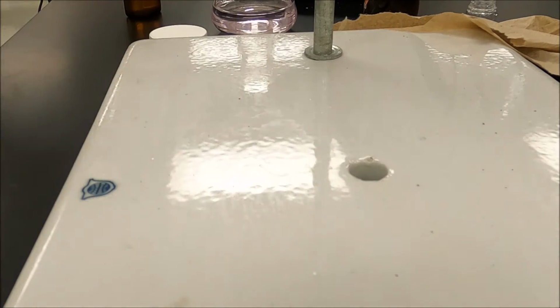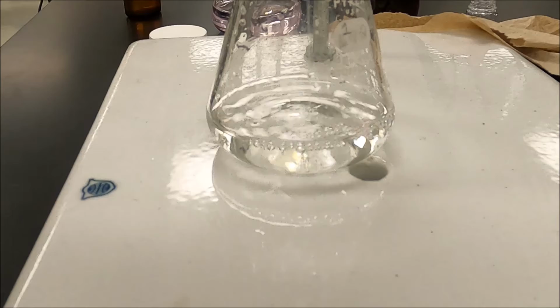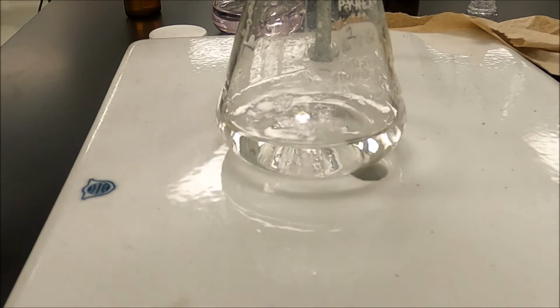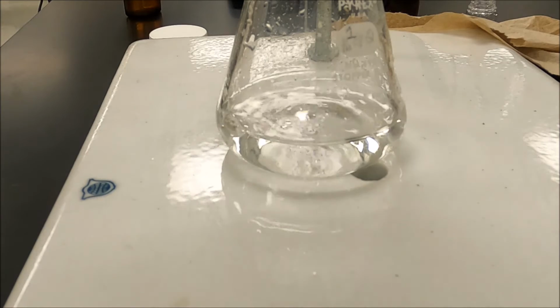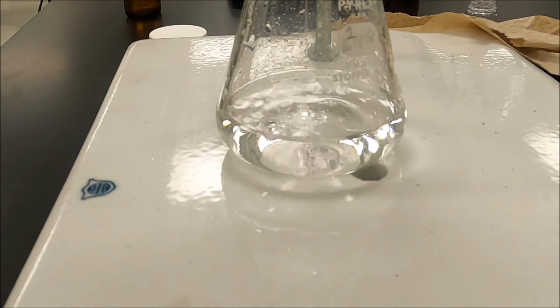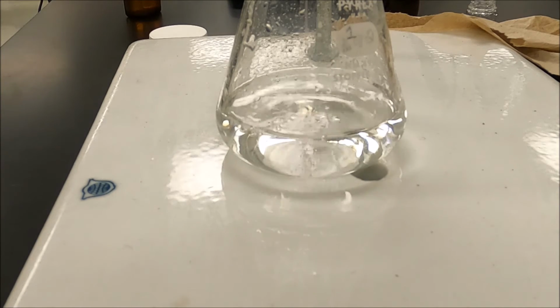Okay, our initial burette reading is 0 again. I know I can go down pretty quick in the neighborhood of 21 and then go from there. I know, we're having to wait, but patience is a virtue. You can do it.